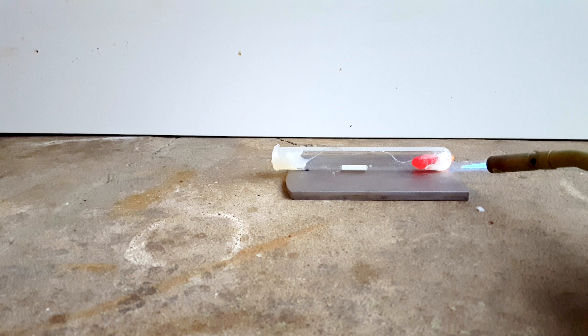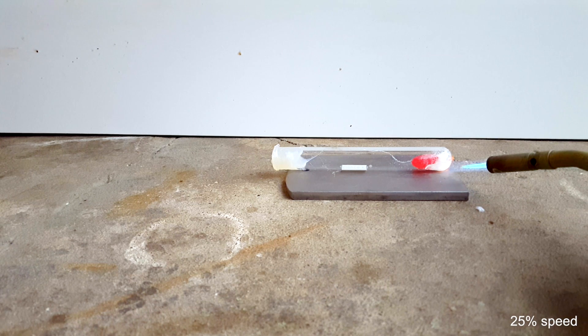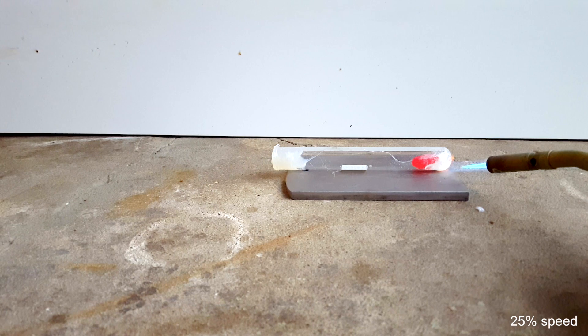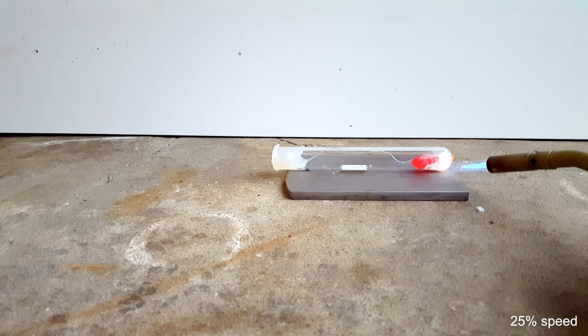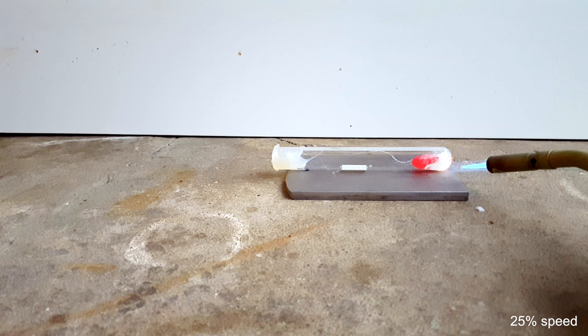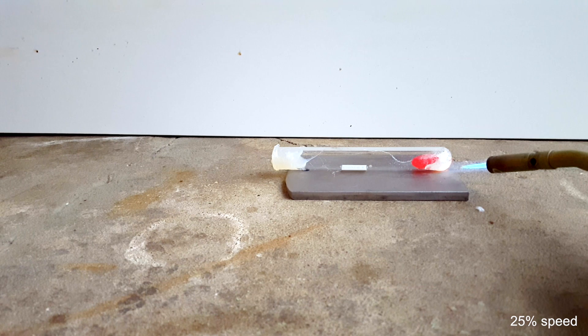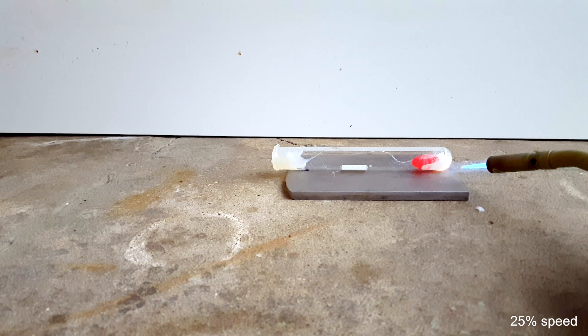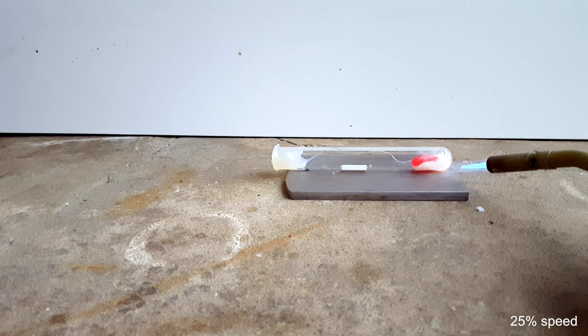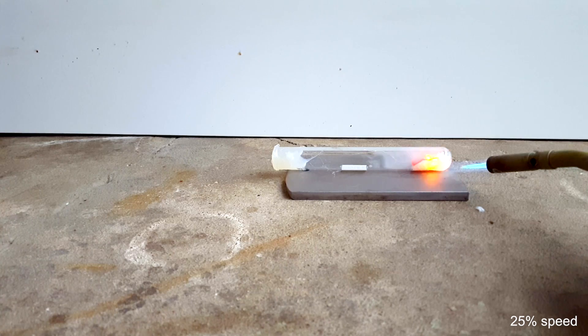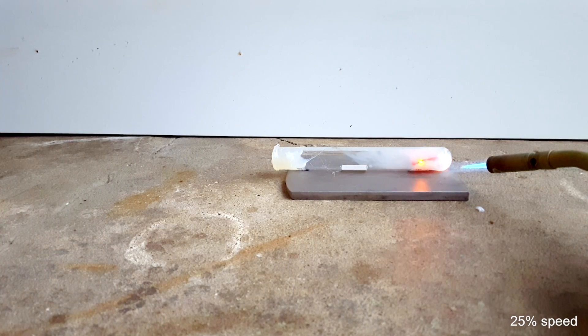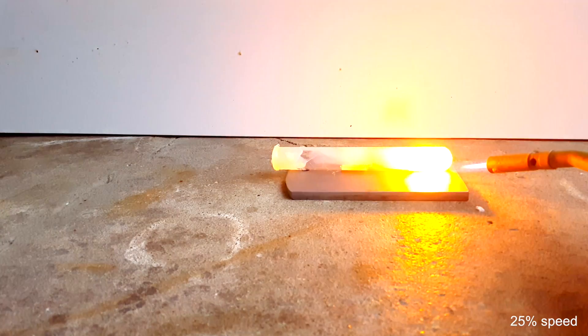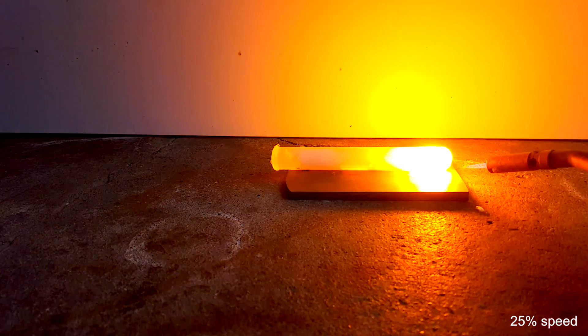First, you can see the sodium chlorate melting, but not yet reacting with the gummy. This happens because it has not yet reached 300°C, where it breaks down into oxygen that drives the reaction. Soon enough though, the reaction jump starts and has little flames coming from the sides of the gummy. Very quickly, the test tube glows as if it belongs in a street lamp, and then it's gone.